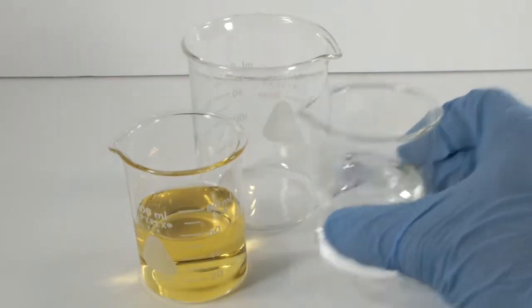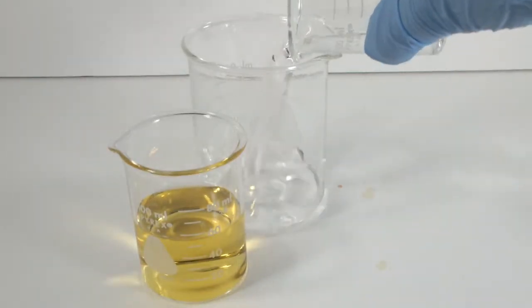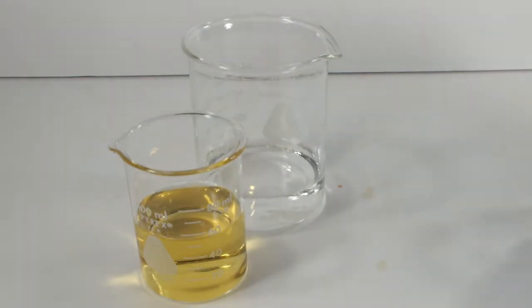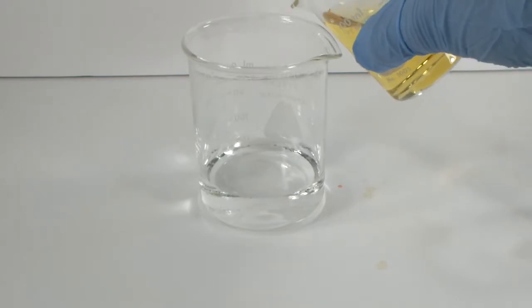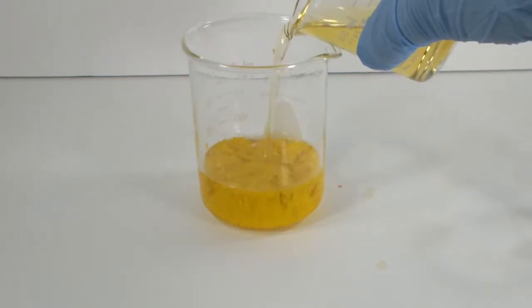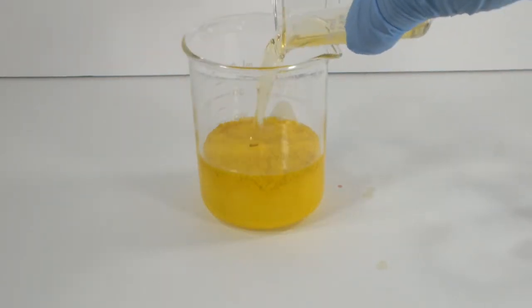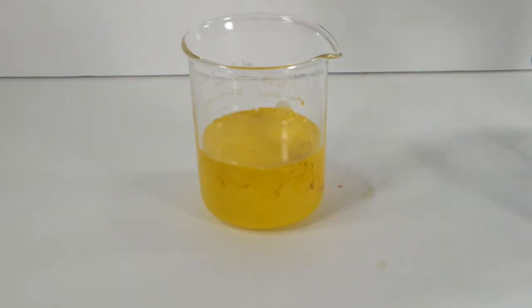The most common use in chemistry labs is the reaction between lead nitrate and iodide ions. In this case, I'm using a solution of sodium iodide. It's colored because of its age, but it still does the job. This nice yellow precipitate is lead iodide. This is a pretty reaction and all, but everyone does it in chemistry class, so I'm going to do things a little differently.